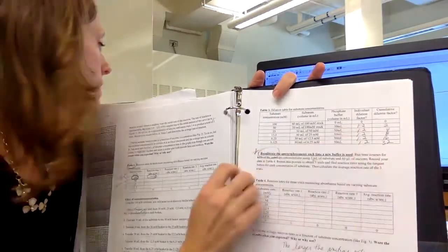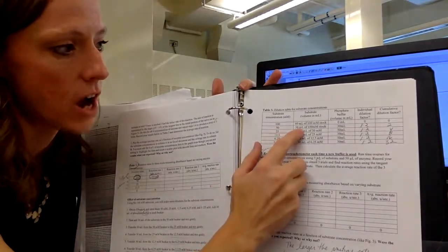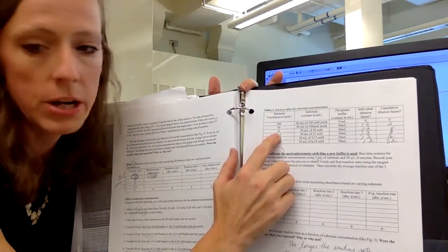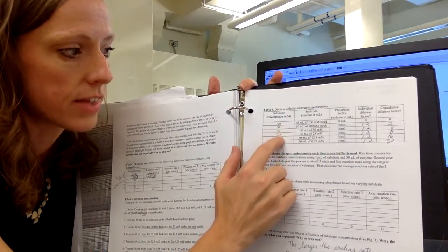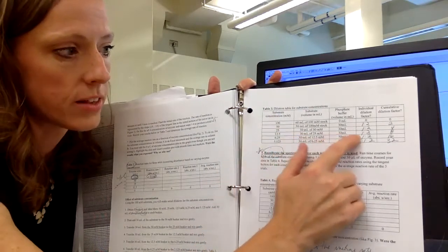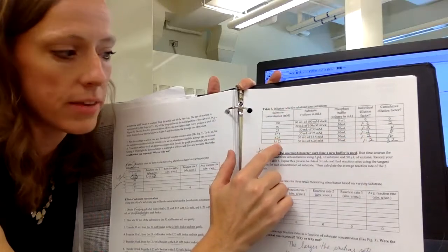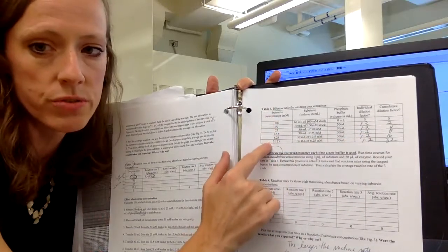And then we continue to make serial dilutions, taking it from 50 millimolar down to 25 millimolar by just diluting the 50 by half again, okay? And take that 25 then down to a 12.5 millimolar concentration by diluting it again by half, just a 1 to 2. And then repeat that and repeat it again until we get all of our different concentrations of substrate.